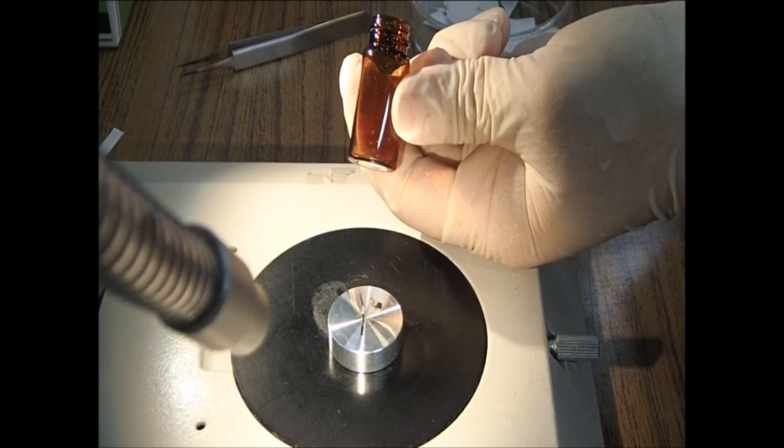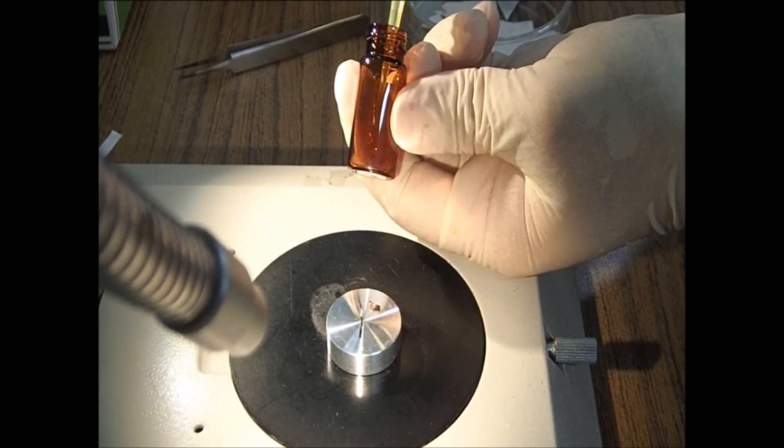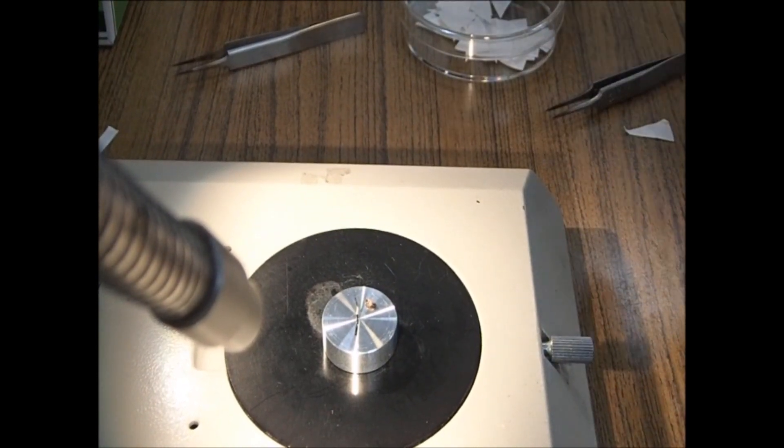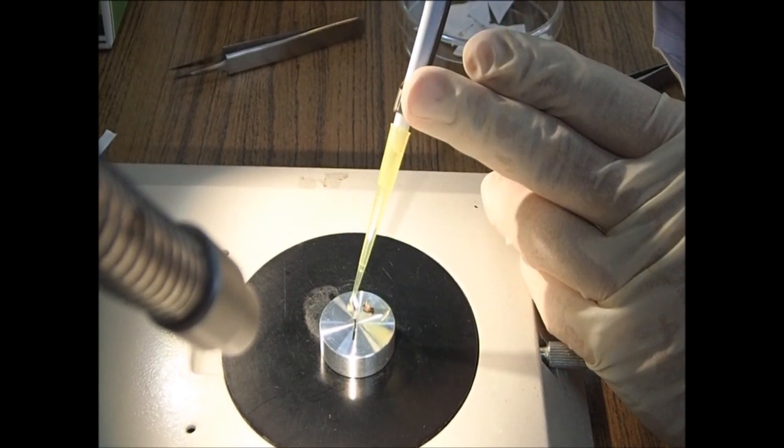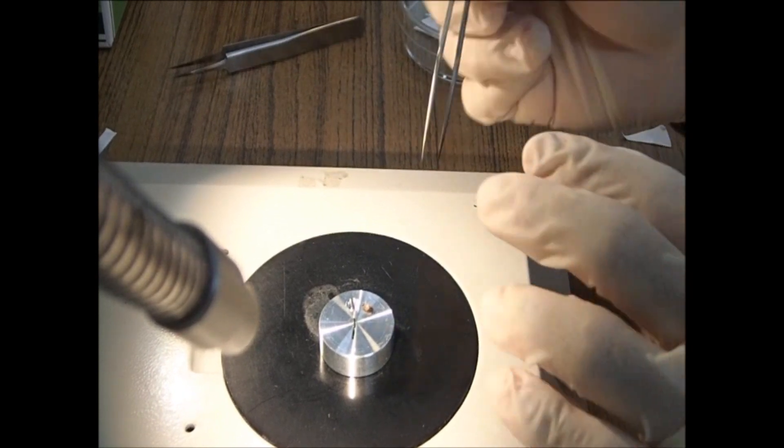Apply a tiny drop of nanosuit solution to the sample. Here, we applied a drop of nanosuit solution next to the sample and moved the sample into the solution using tweezers.